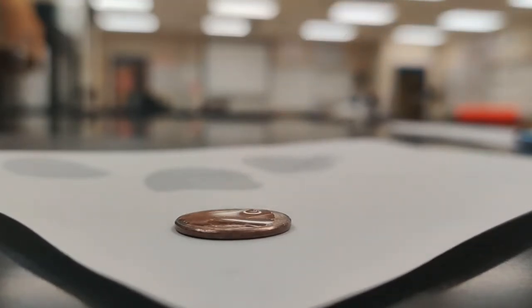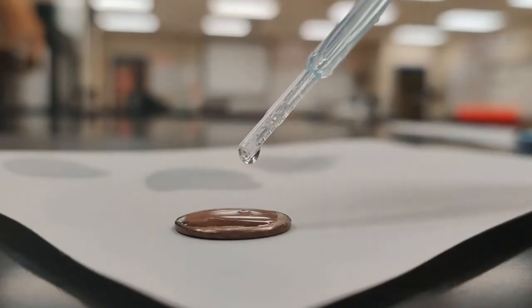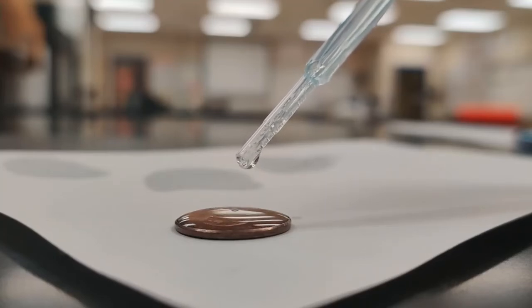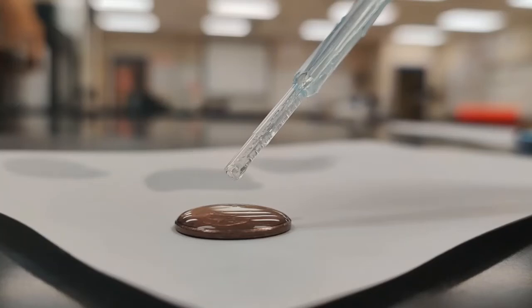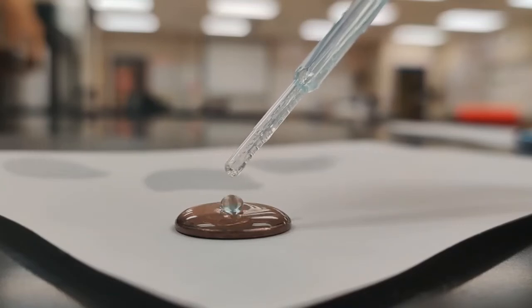Let me see if I can get that off the surface. 3, 4, 5, 6, 7, 8, 9, 10, 11, 12, 13, 14, 15, 16, 17, 18, 19.